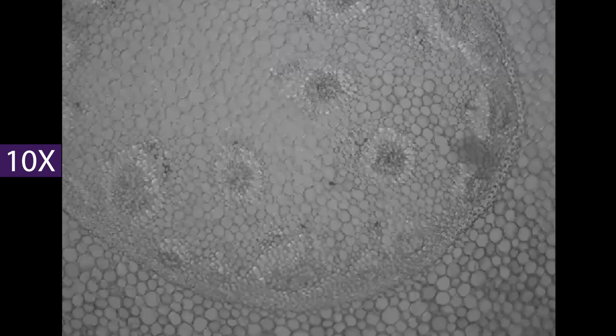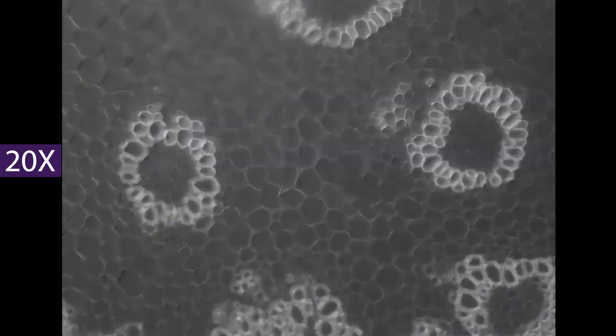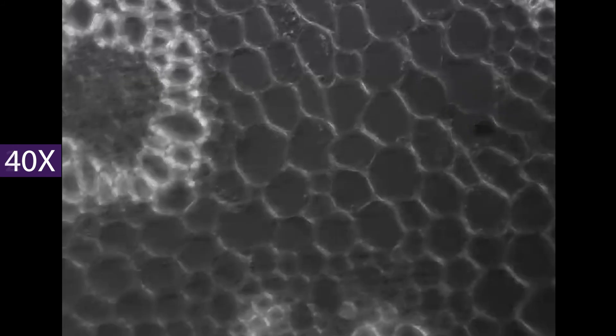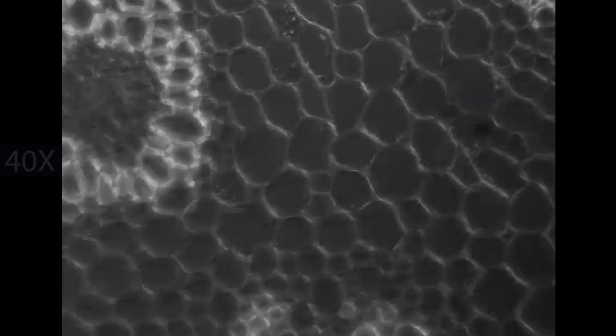A correctly aligned microscope will provide in-focus images at both the eyepiece and camera throughout the range of installed objectives with no or minimal readjustment of the focus wheels.